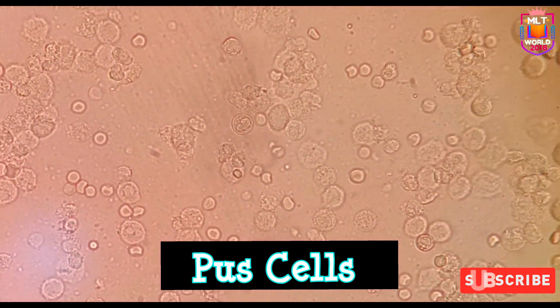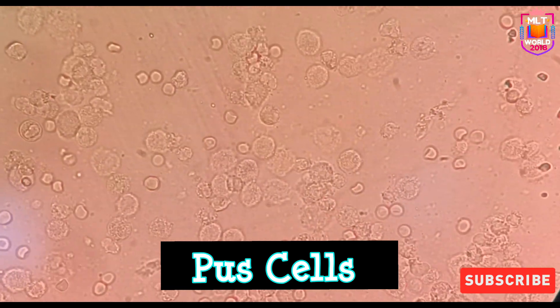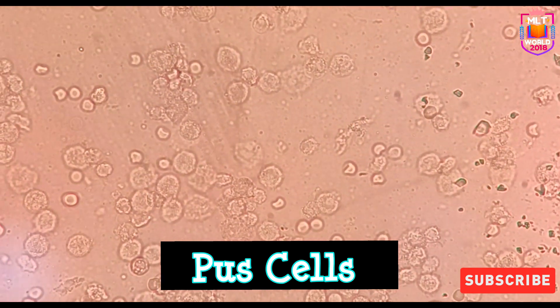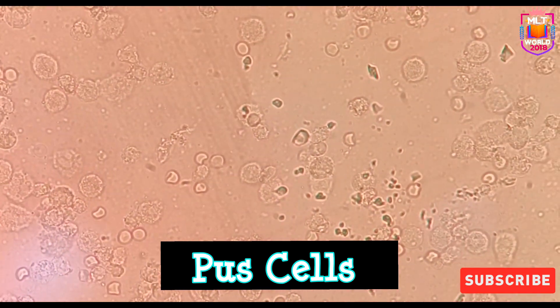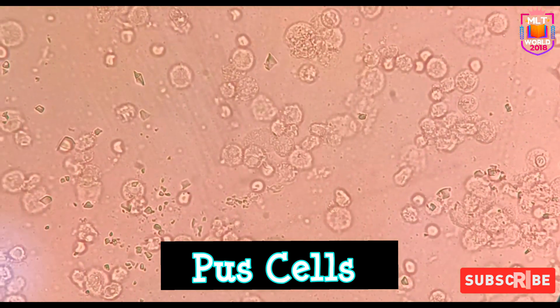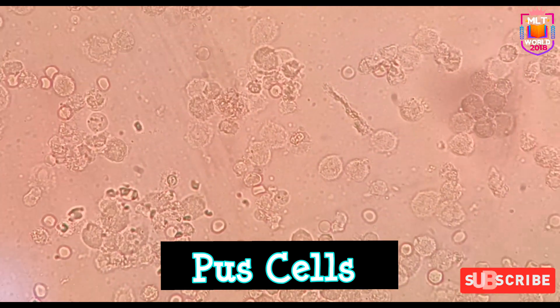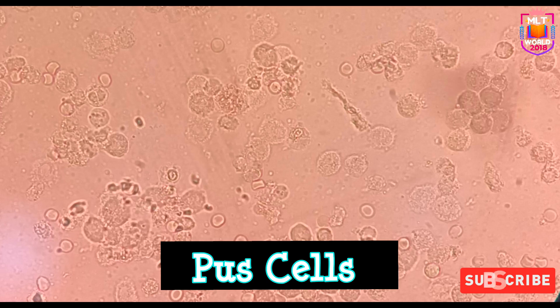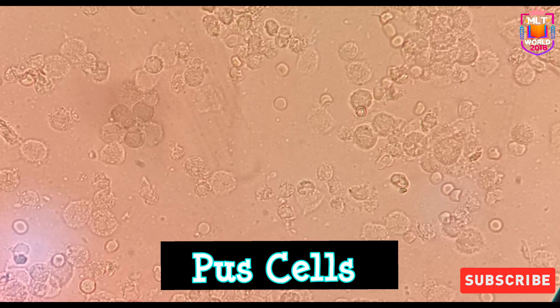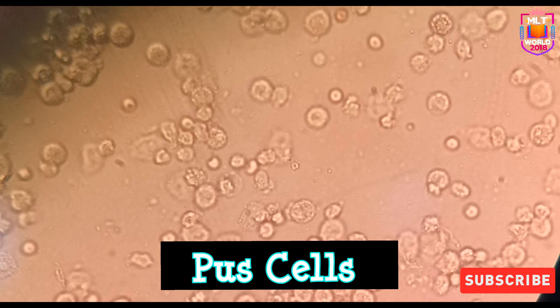Welcome back to MLT World Channel. Today in this video I am going to share urine microscopy slides. In urine routine examination under the microscope, the three main things that we commonly see are pus cells, red cells, and epithelial cells. I will show you how to differentiate between pus cells, red cells, and epithelial cells. This video will be very helpful especially for students and those working in the microbiology department.